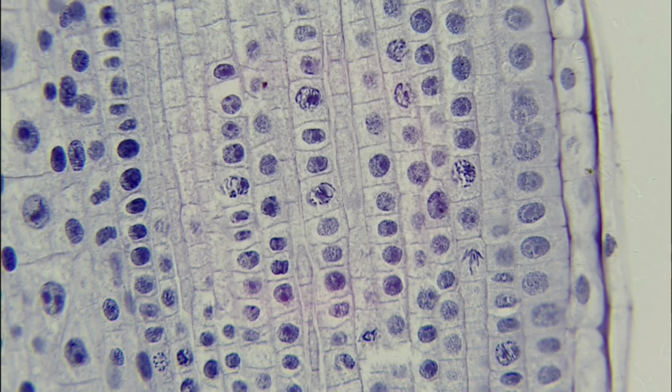And just to touch on the stages of mitosis in order, we're going to go from interphase when the cell is at work, to prophase when all of the chromosome is condensing, and then metaphase when all of our chromosomes are lined up along the center of the cell, to anaphase when those chromosomes are split apart into those sister chromatids or just chromatids, whichever one you prefer. And then telophase when we're starting to form back two individual cells or identical daughter cells. So let's go ahead and jump in and start practicing identifying the stages of mitosis.